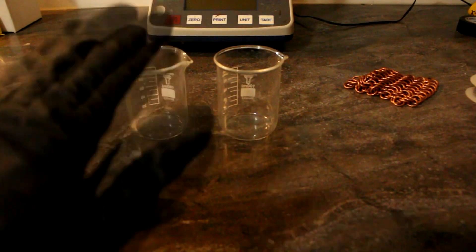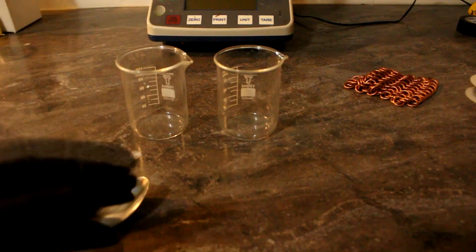Hi there everyone, welcome back to Cody's Lab. So today I'm going to show you an easy way to make ammonium hydroxide very cheaply.